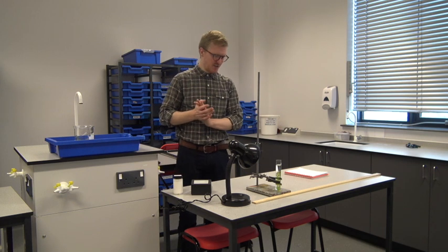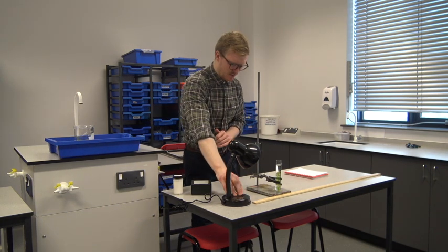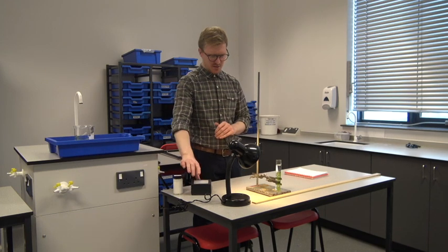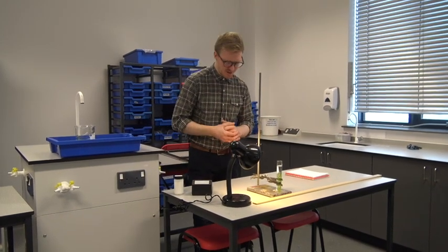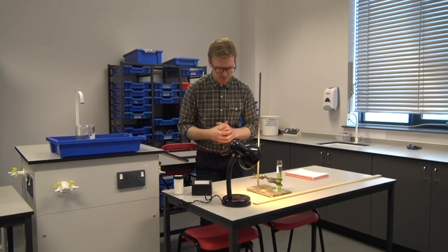Okay, so I'm going to get this started. If I turn on my lamp, and what I'm going to do is just give it a minute to set off. And then hopefully what we should start to see is bubbles coming from the plant.